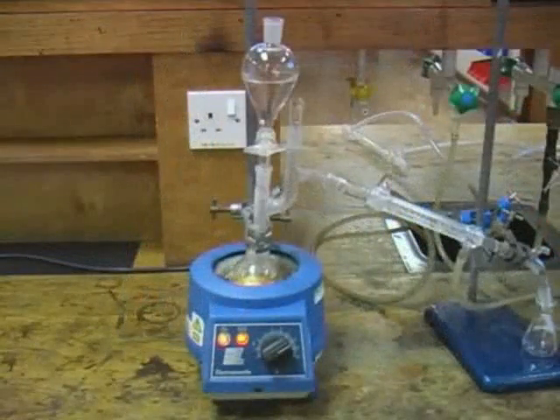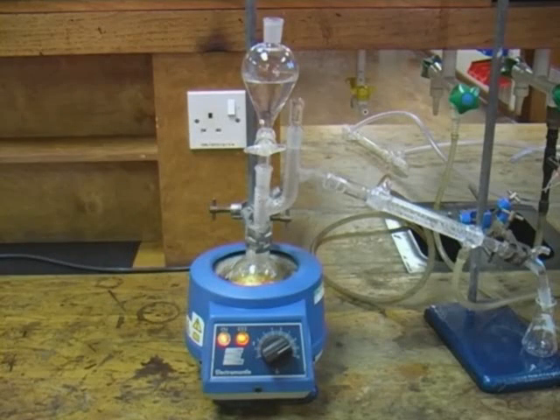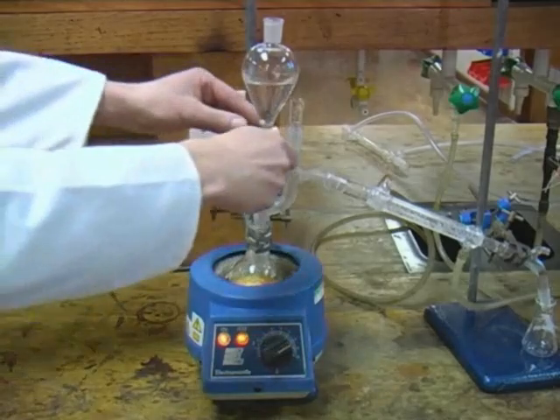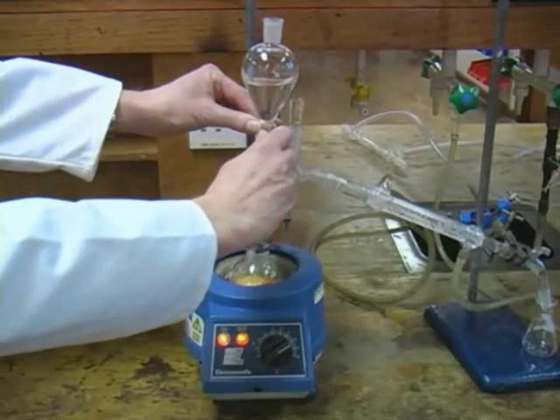The water in the flask boils, generating the steam required for the distillation. We can maintain the level of the water throughout the distillation by adding more of it in small portions from the dropping funnel.